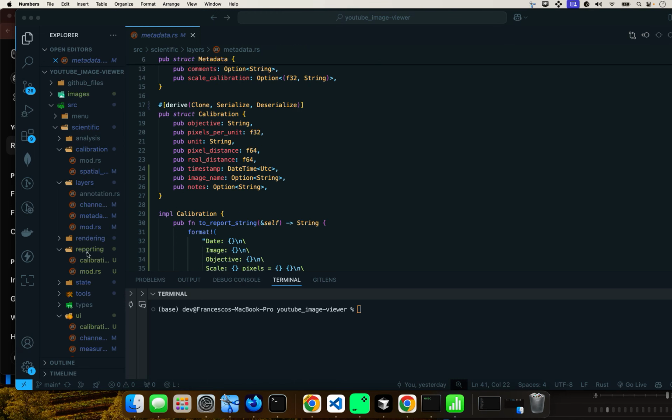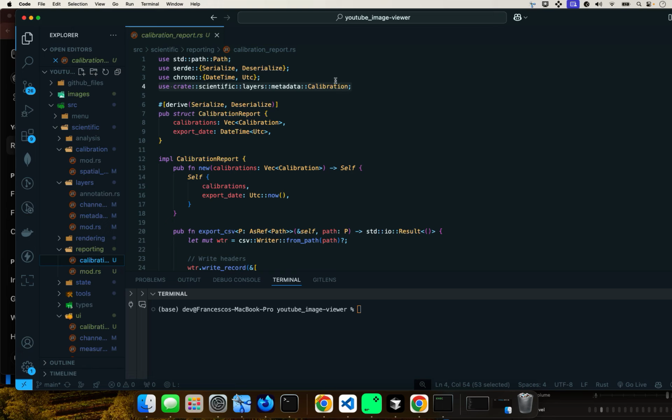And we go back to the calibration report. So this is what this is bringing right here. Here is using Serde, serializing, and it is importing the calibration struct, which is going to have all of the calibration data in that vector right there. And the UTC is just going to be importing the calibration timestamp basically, and used to get the current universal coordinated time.